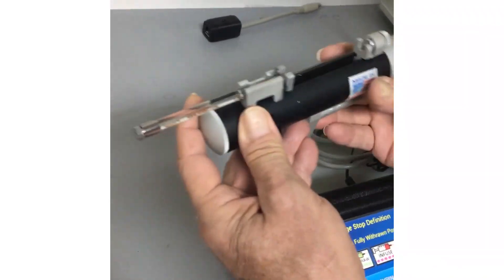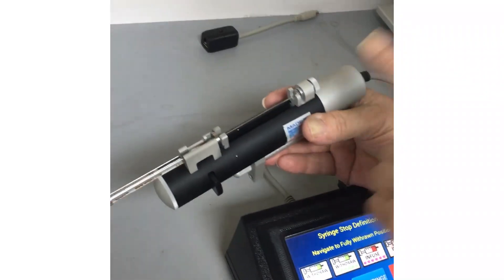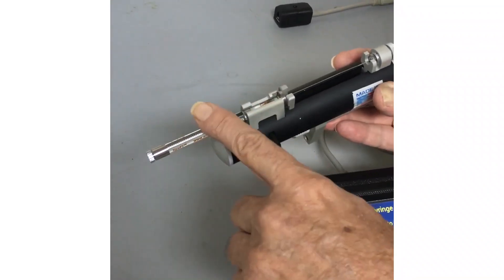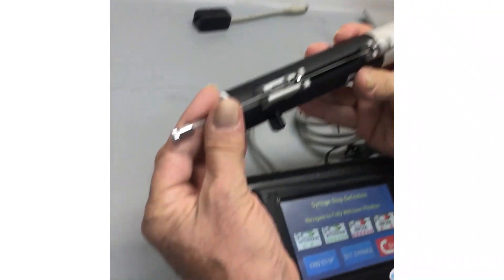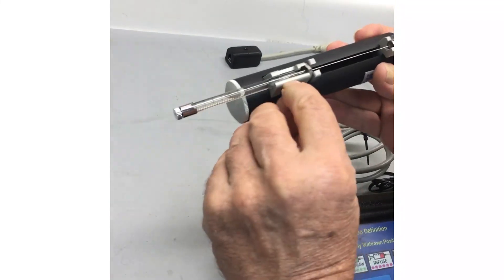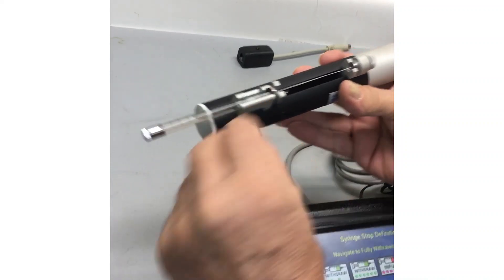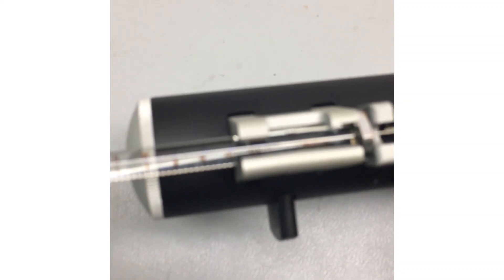That defines the end stop of the mechanical motor drive in here, but that's not the top of the syringe. We have a 10 microliter syringe, so now we have to define the top of the syringe. This is very difficult to see, but when you look into the glass barrel against the markings, you're going to see that the plunger — the tip of the plunger — lines up with the 10 microliter mark in this particular case. Sometimes you have to use magnification in order to see it.